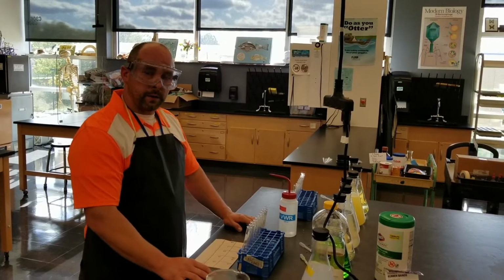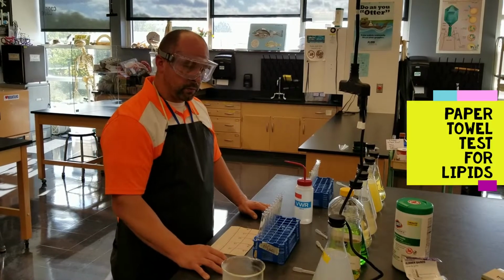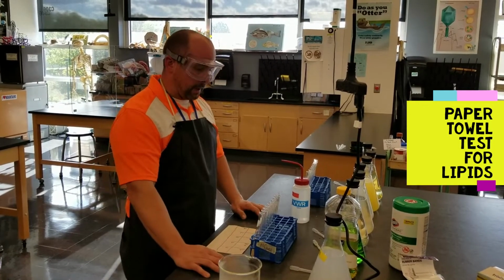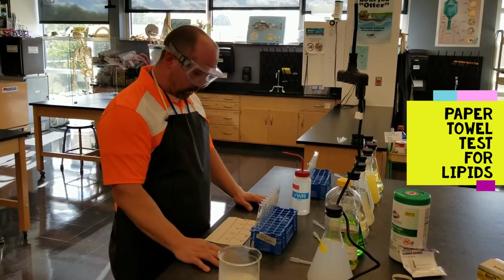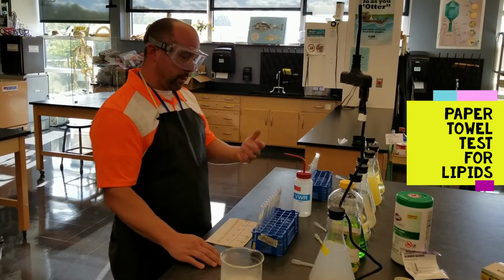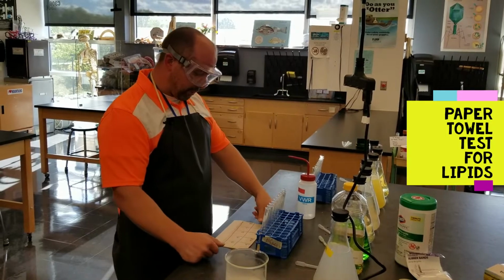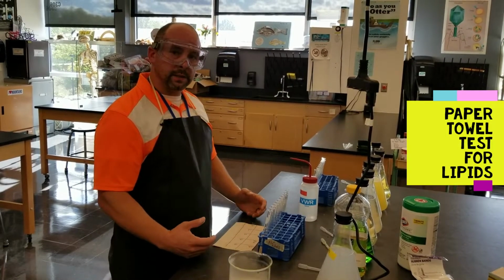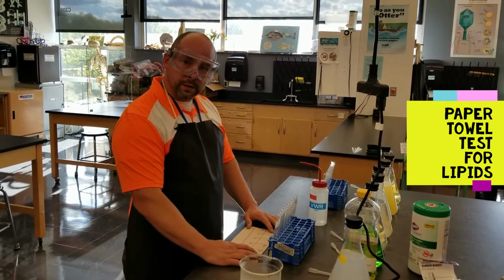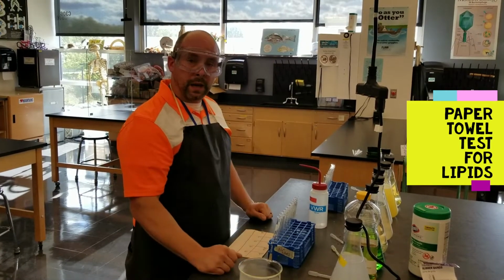All right, so our first test, we're going to be testing for the presence of lipids. An example of a lipid would be a fat, an oil, cholesterol, etc. And one easy way to test for that is something called the paper towel test. What we're simply going to do is take a drop or a finger drop of the solution and place it on a piece of paper towel and give it time to dry. If it has lipids in it, it will create a translucent surface on the paper towel in which when you hold up to light will easily pass through the paper.